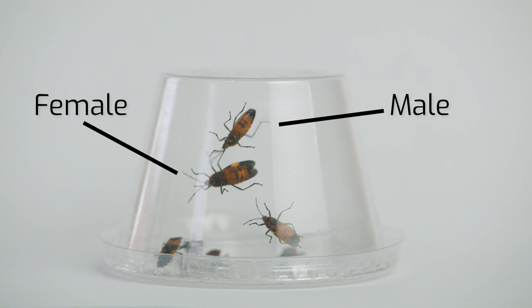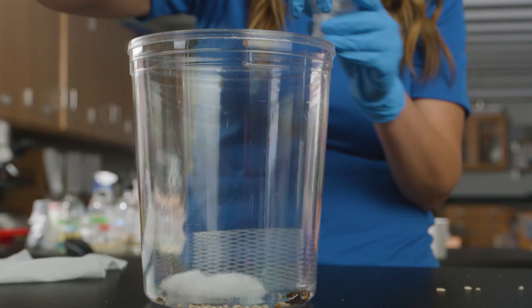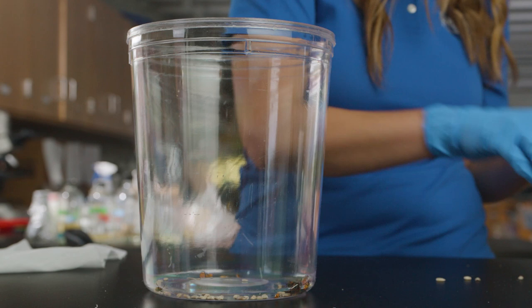If you plan to keep your culture going, the culture container may become dirty. We recommend having two culture containers to move your culture between. Wash the container with soap and water. Make sure to dry it completely before reintroducing your culture.